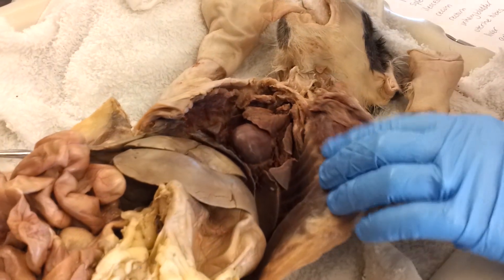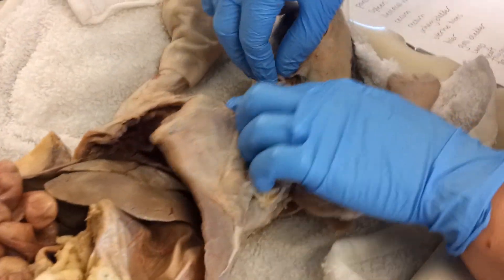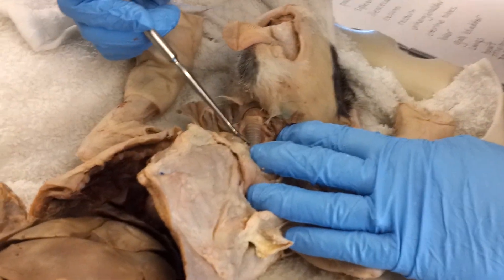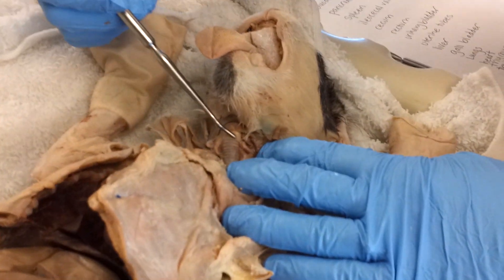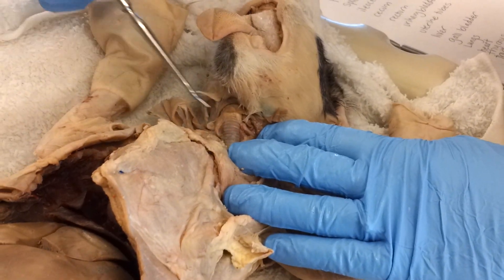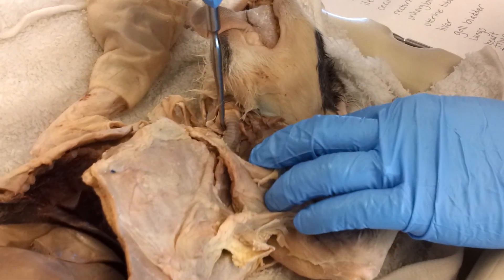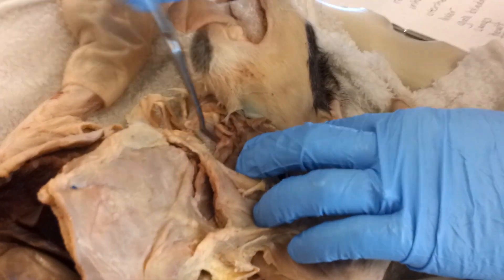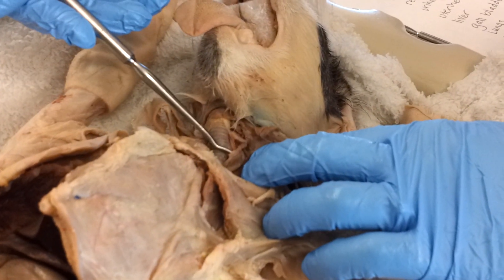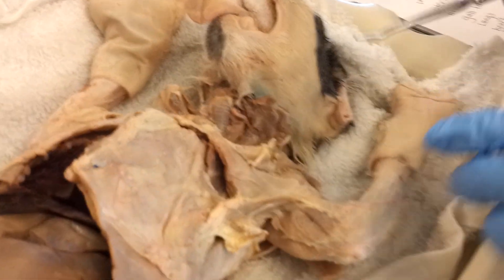Up in the neck region you can see, using my probe, the trachea. You can see the hyaline cartilage that protects the trachea from collapsing. Then behind it is a strong muscular tube — that is the esophagus.